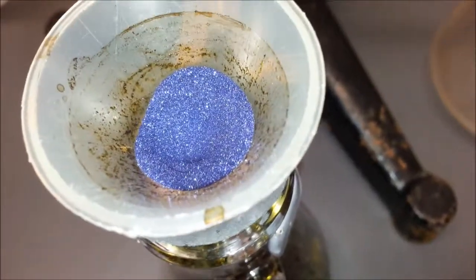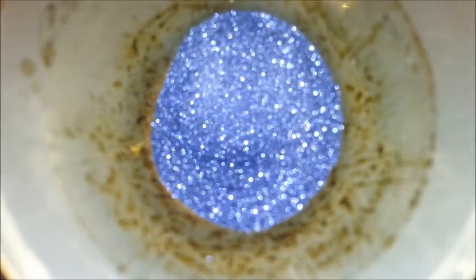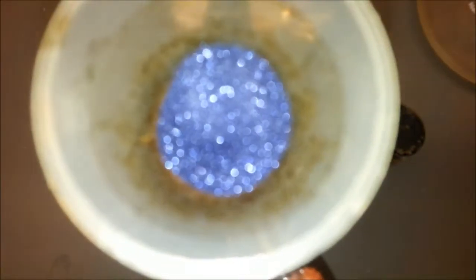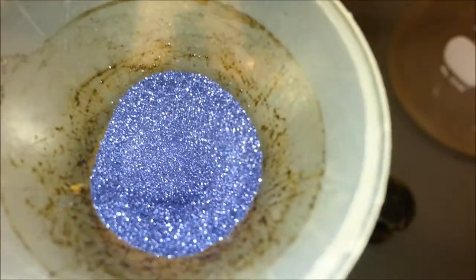I love the diffraction on that. Wow, that's amazing. It's beautiful.